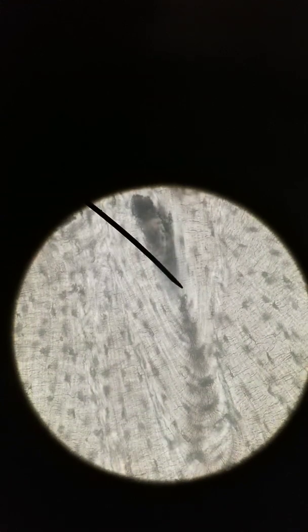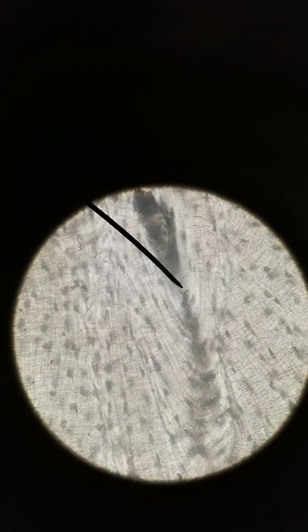You have central canals that are running up and down the length of the bone, but there's also perforating canals. And I don't know that we have a perfect example of this here, but this is the best I can do because you have to get just the right cut. You can imagine central canals go up and down the bone, perforating canals go side to side through the bone. And so this is kind of showing probably like a small cut of a perforating canal.